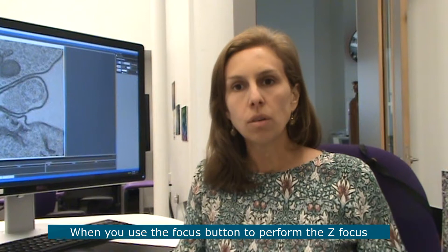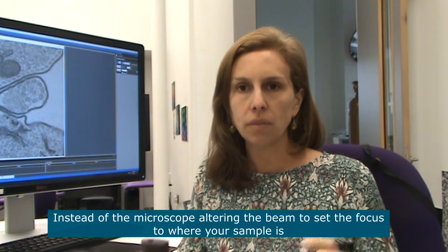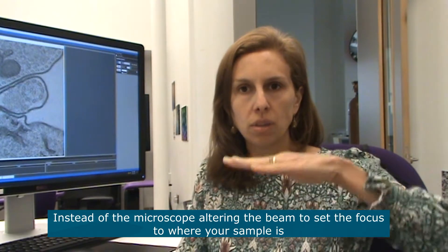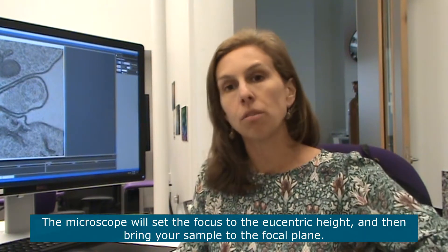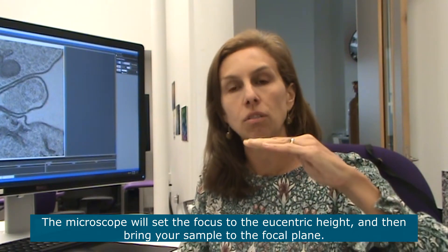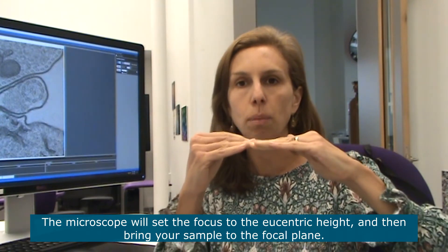When you use the focus button to perform the z-focus, instead of the microscope altering the beam to set the focus to where your sample is, the microscope will set the focus to the eucentric height and then bring your sample to the focal plane.